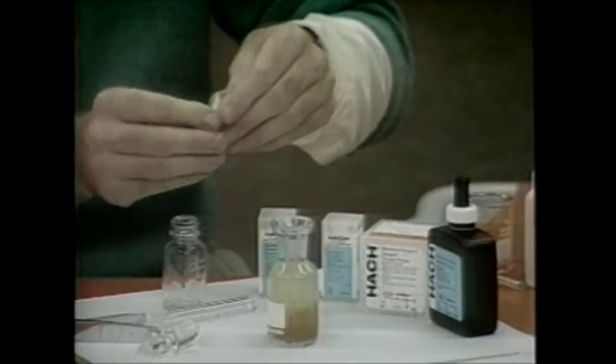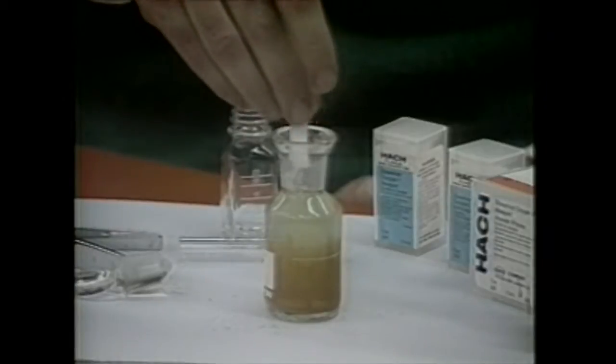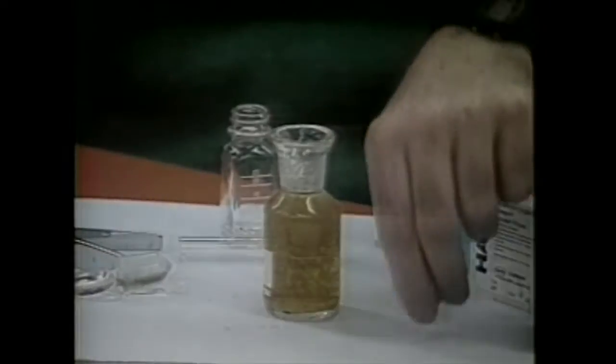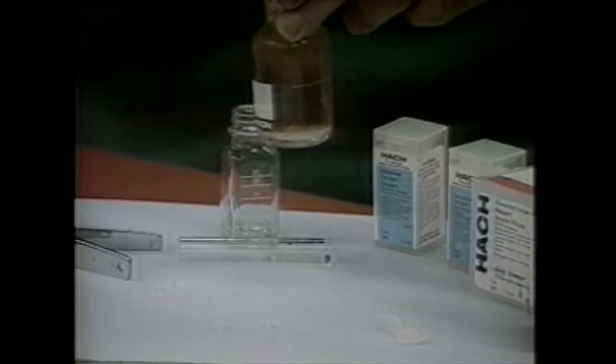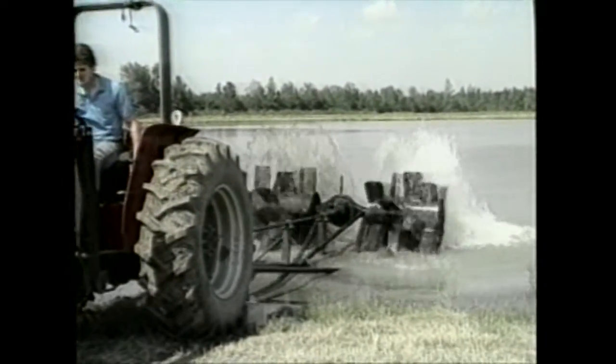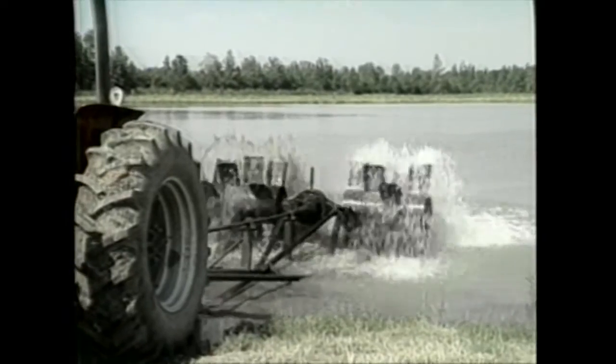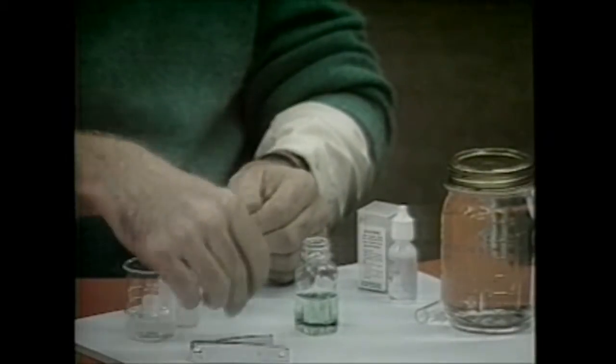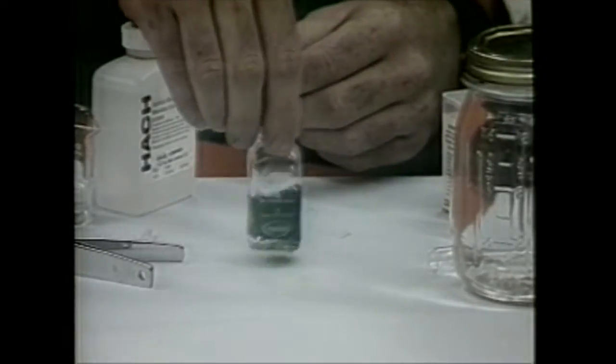As mentioned throughout this video series, successful fish production is dependent on the quality of water present. Tapes 1 and 2 of this series have introduced important water quality parameters and their influence on the biology and chemistry of a typical fish pond. However, in order to properly manage the water quality of a pond, methods of measurements of the various parameters must be understood. Therefore, the purpose of this tape is to describe the testing procedures and the water quality parameters which were discussed in Tape 2. Corrective measures for each parameter, if found to be at levels adverse to good fish production, will also be discussed. Testing procedures and corrective measures concerning total alkalinity and hardness were presented in Tape 1 of this series.